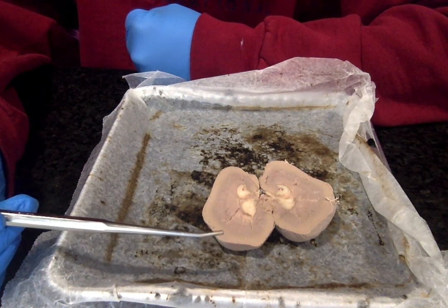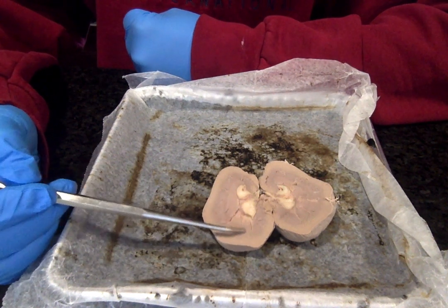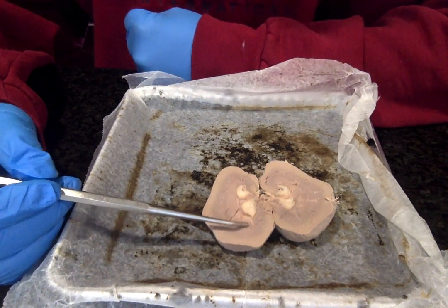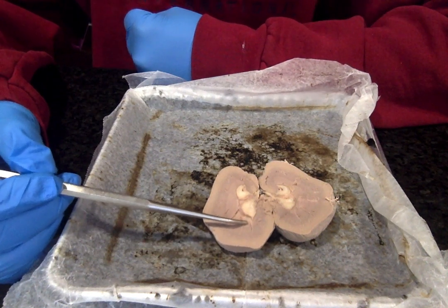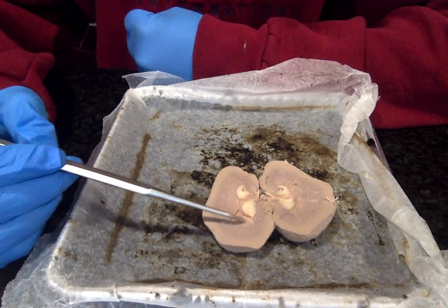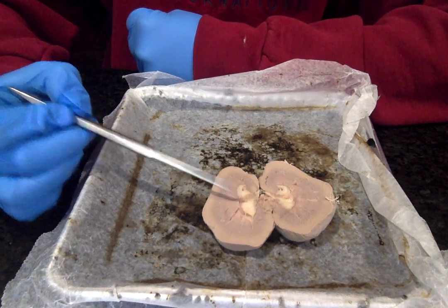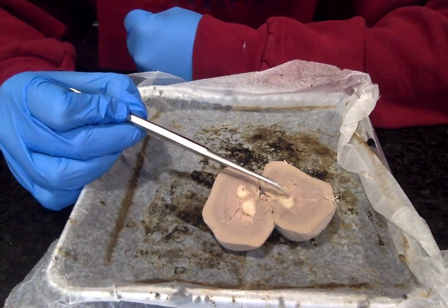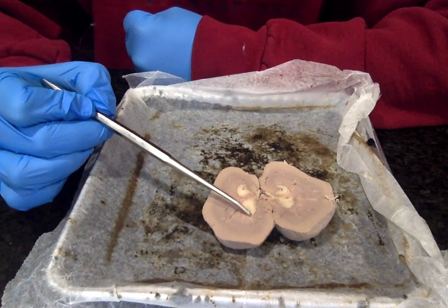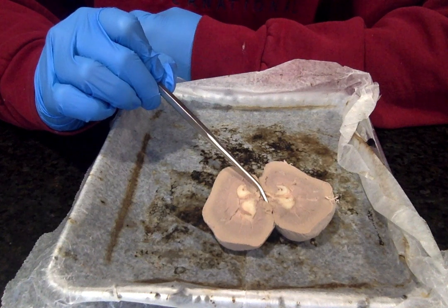Inside the renal pyramid again, which are these structures, is what's called the renal papilla. It's at the apex of the renal pyramid, so down in here, which is continuous with these minor calyces on each side. Into the renal pelvis, which is this white region on both sides. This is the large cavity that receives the urine from the minor calyces out here. And it's continuous with the ureter, so it will exit down into there.